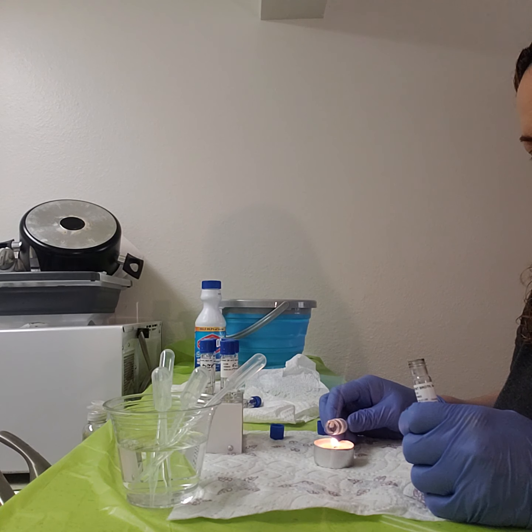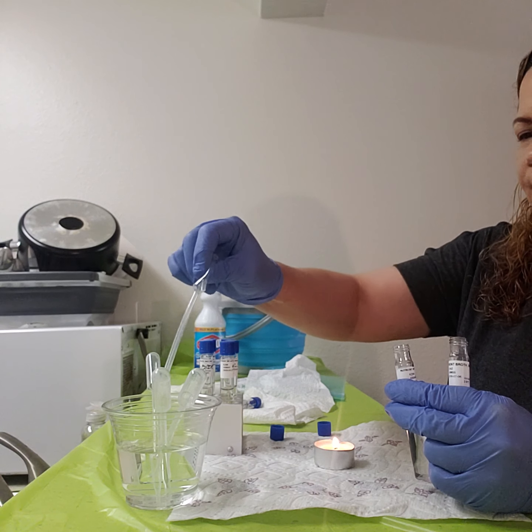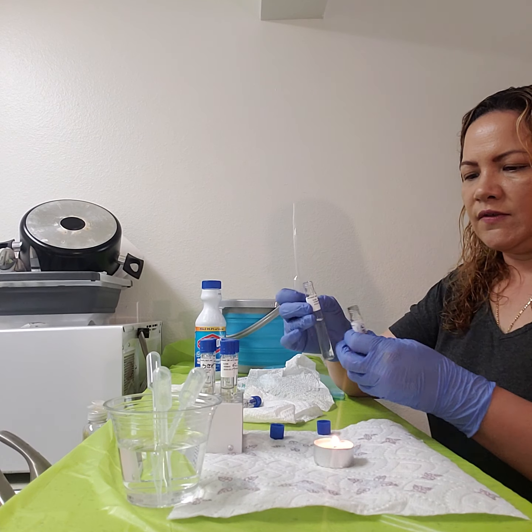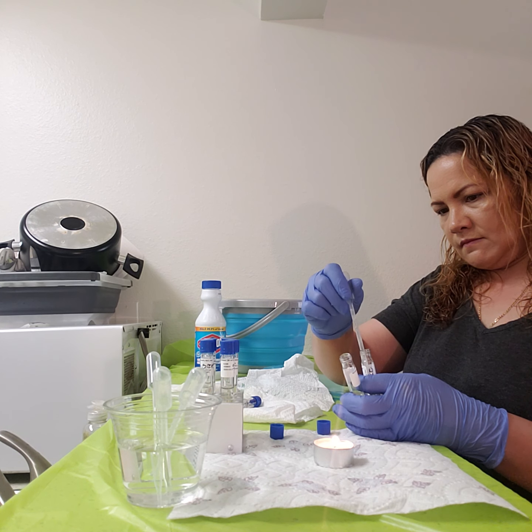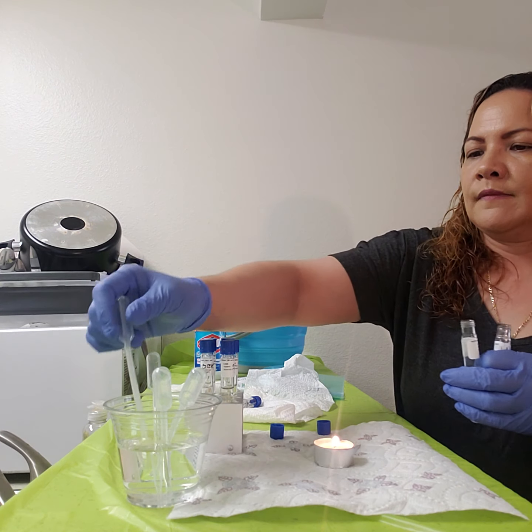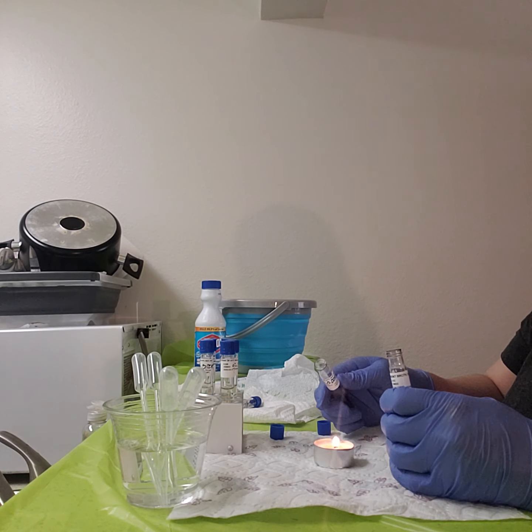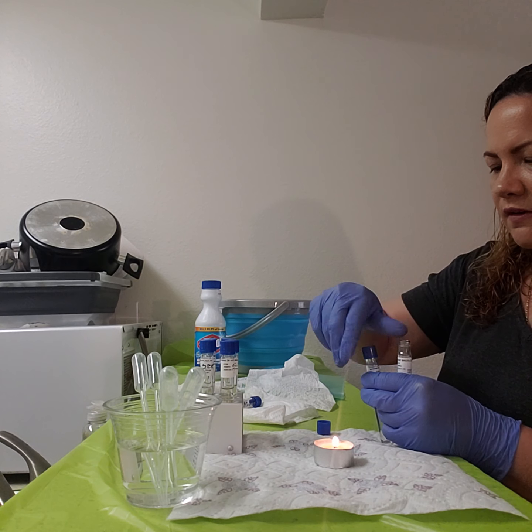It's easier. Okay, so now I'm going to use another pipette. Okay, and I'm only needing to take 2 drops. So this is the one that's 1%, and this is the one that's the broth. So I'm going to take 2 drops from here. So here's 1, 2. Okay. It just helps to clean it out a little bit. Okay, so I'm going to go ahead and sterilize this one again. This is the 1%. The lid back on.